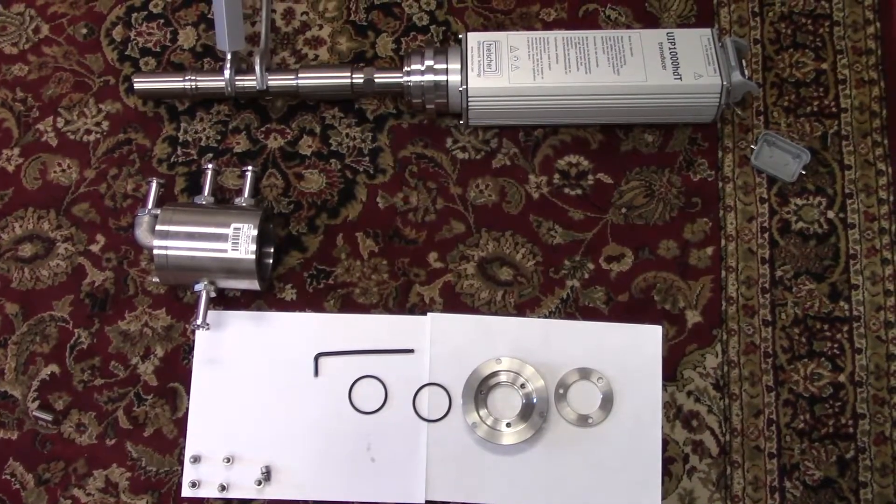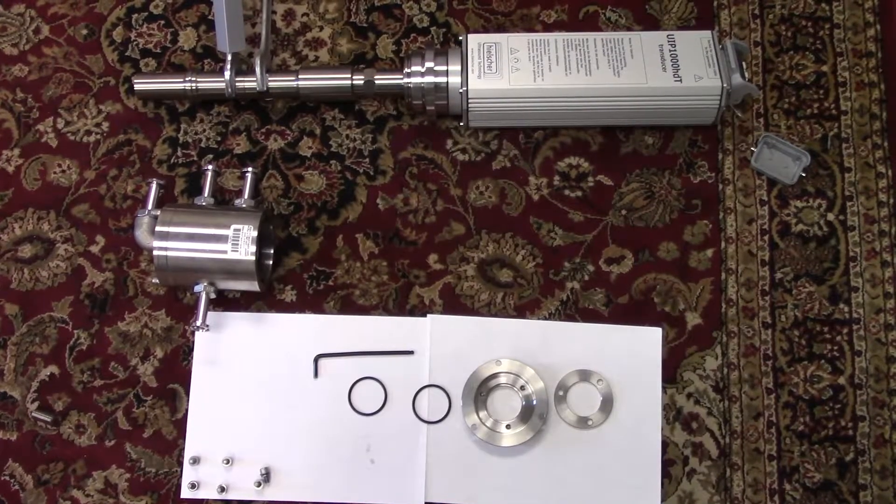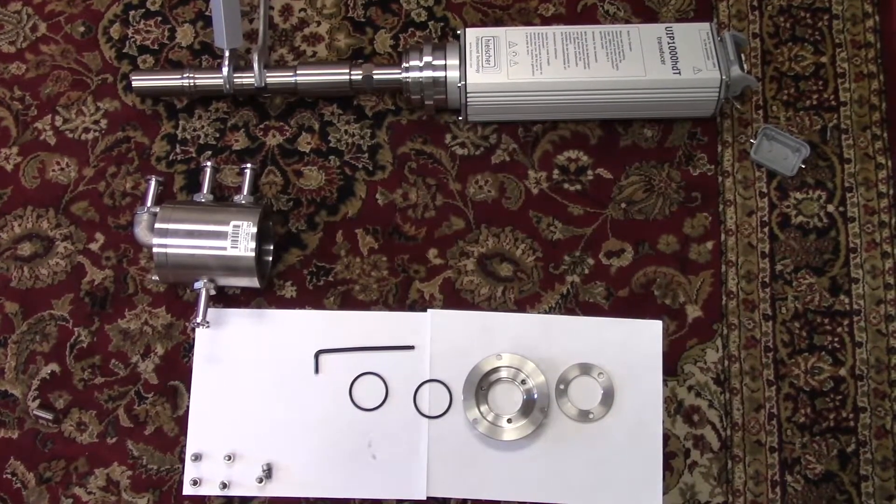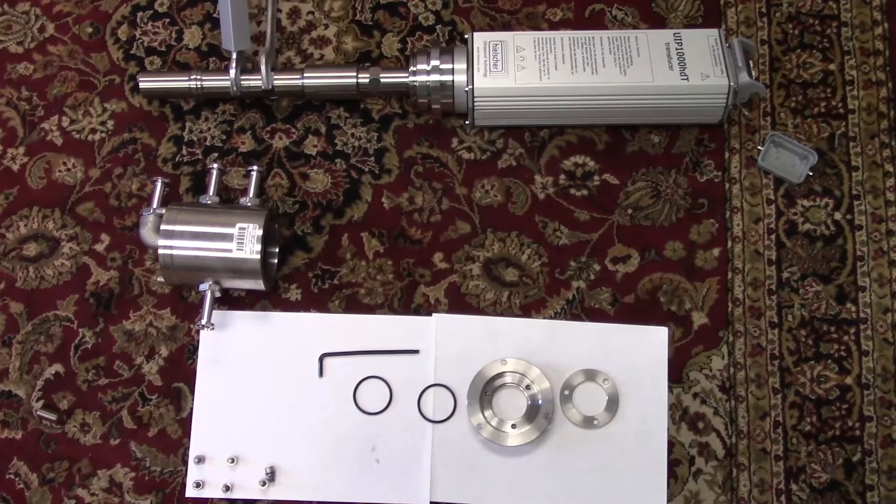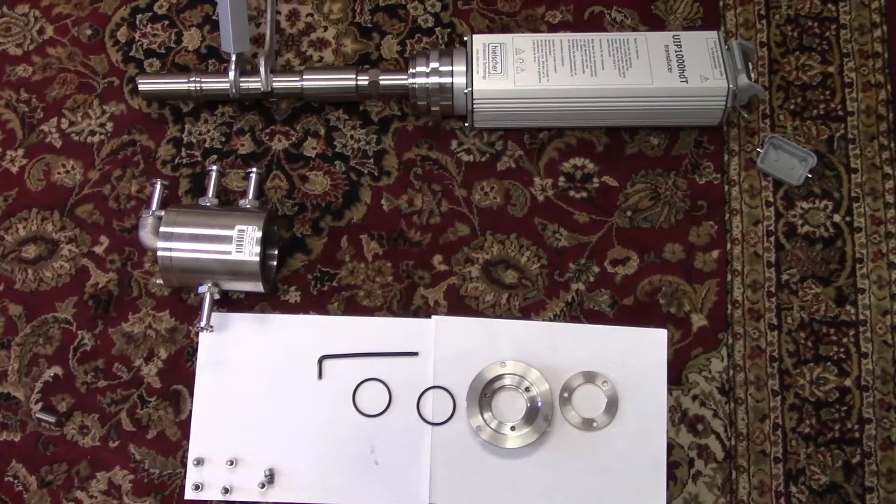Today we'll be assembling a flow cell onto the UIP series ultrasonic processor. Please power off the unit. Please disconnect all cabling.